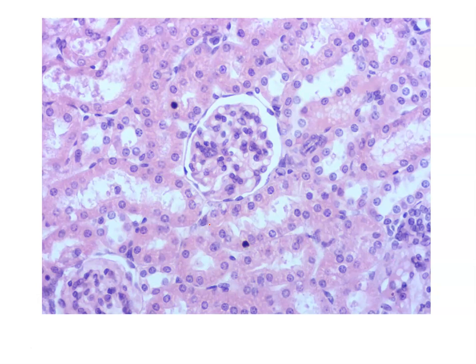The first type of epithelium, which is the simplest of our epithelium, is a single layer of flat-shaped cells. So here in the kidney, we have a structure known as the renal corpuscle, which is part of the nephron. We know that the kidney, of course, filters blood to form urine, and the nephron is that main functional unit of the kidney that allows the kidney to filter the blood to form urine. And 2 structures that make up the nephron are the renal corpuscle and the renal tubules.